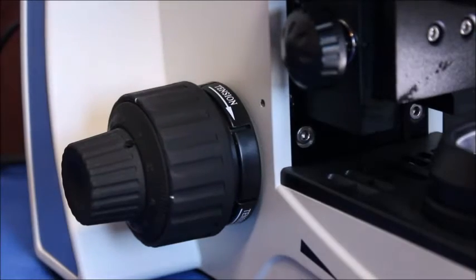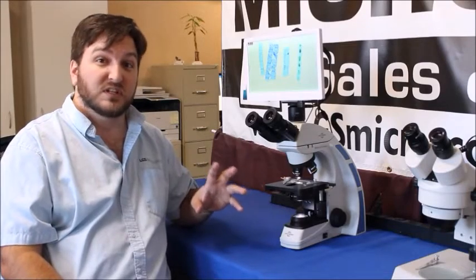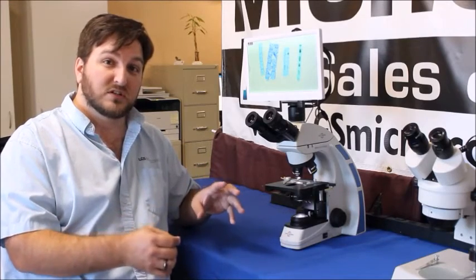You might notice the stage going down with the knobs starting to turn on their own. This can be fixed really easily so today we're going to go through a few different microscopes and different styles of focus tension so that you can make this simple adjustment yourself.